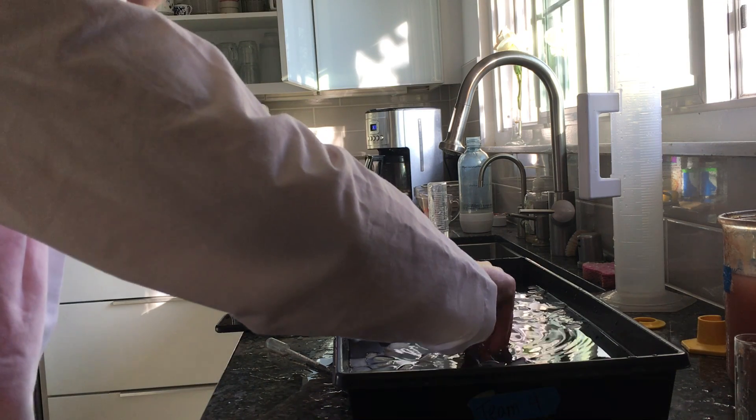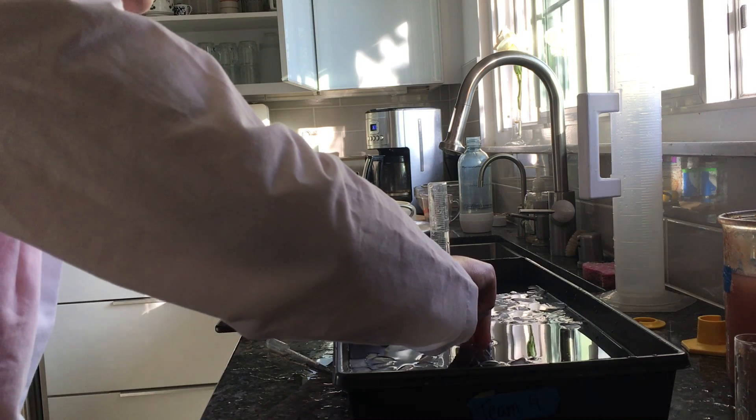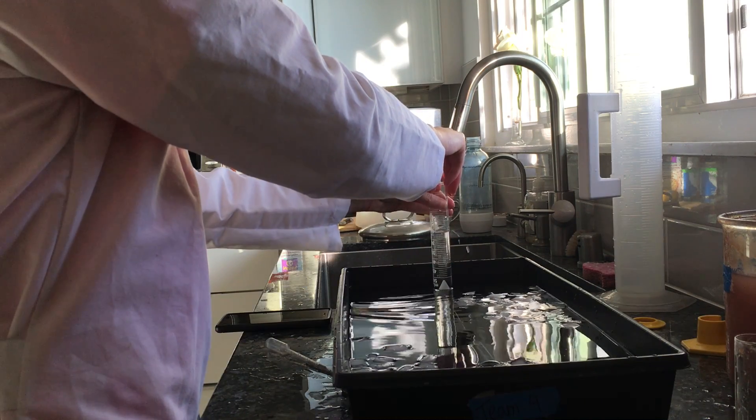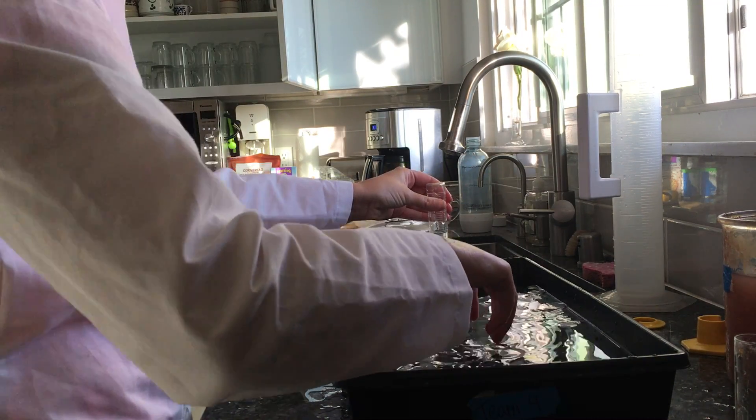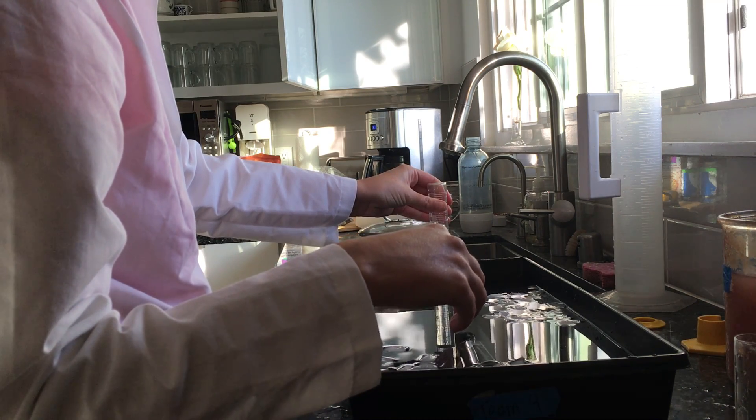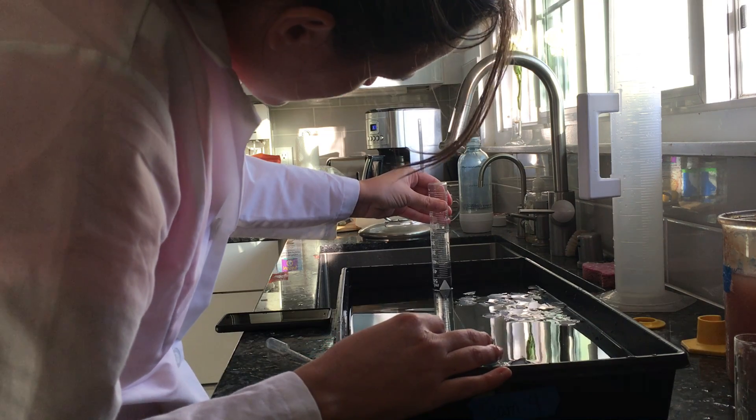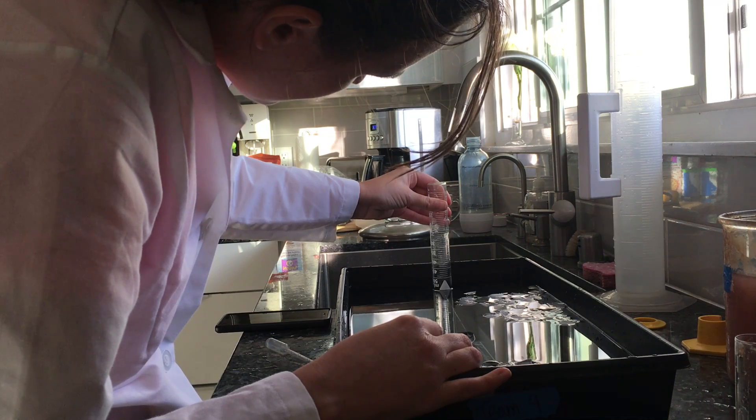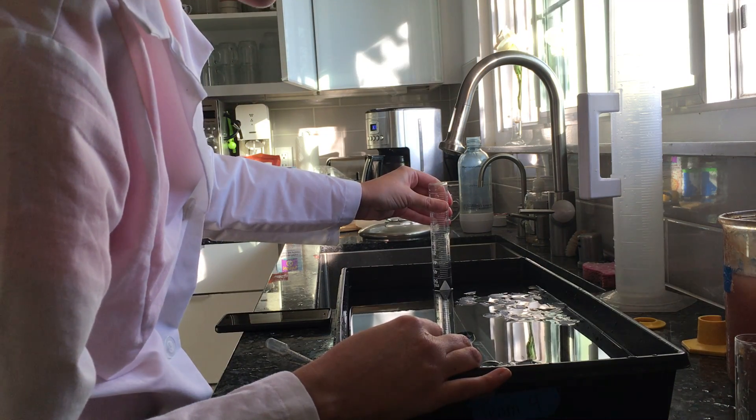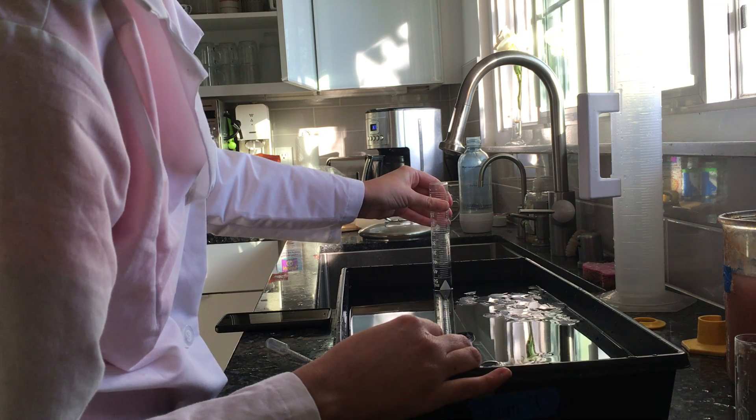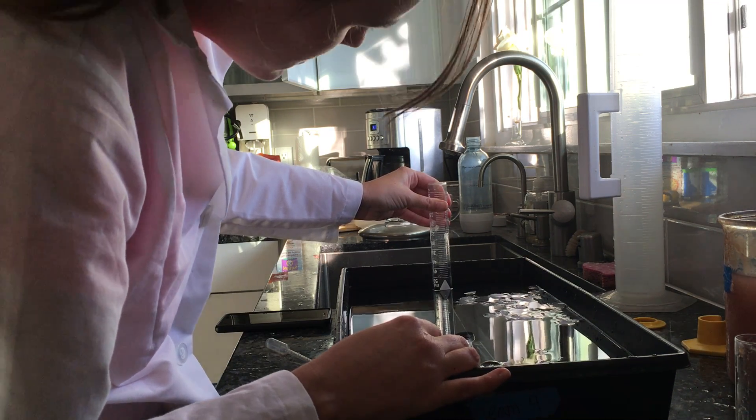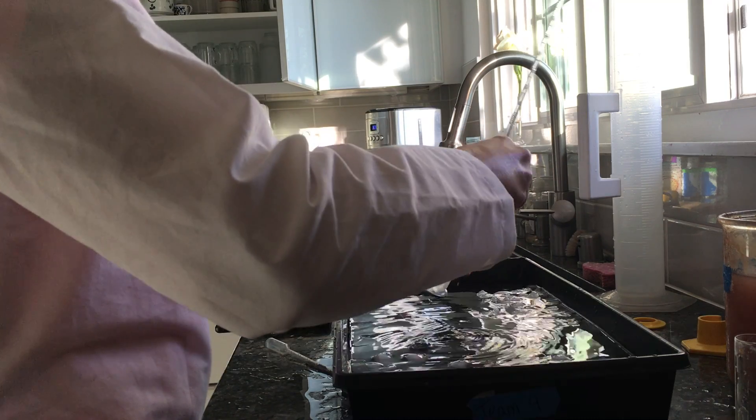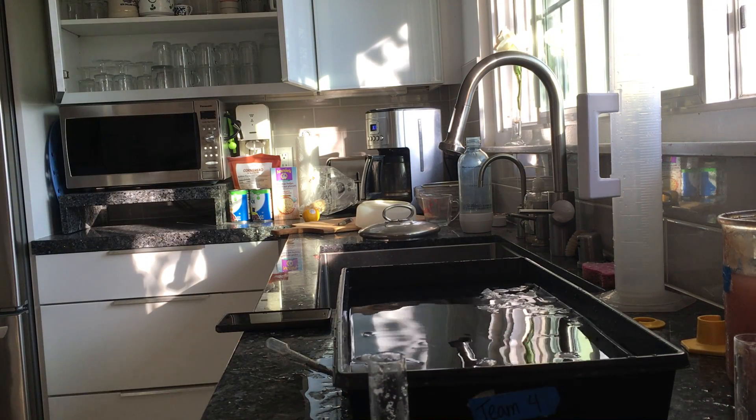At one minute 30 we're at 25 milliliters. Two minutes, 26 milliliters. Cool, okay let me change out the water again and wash my hands.